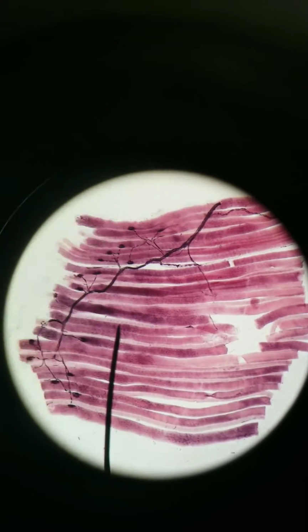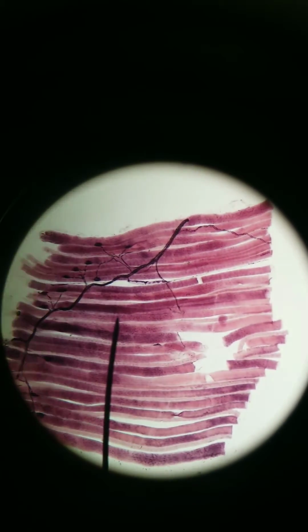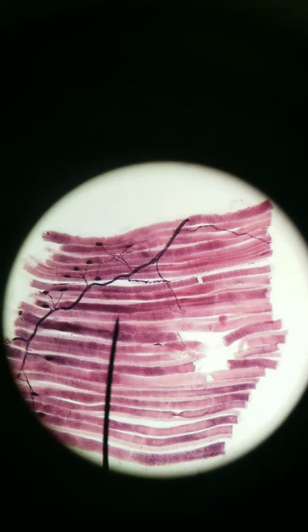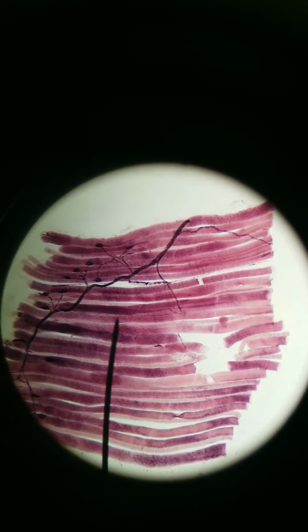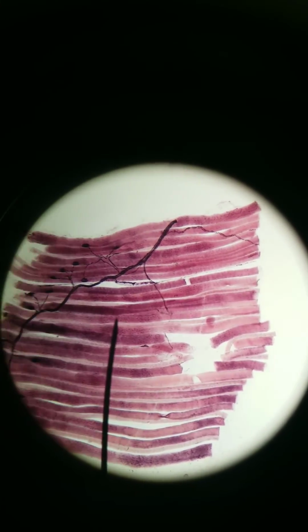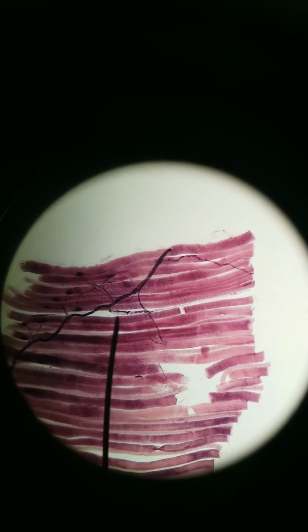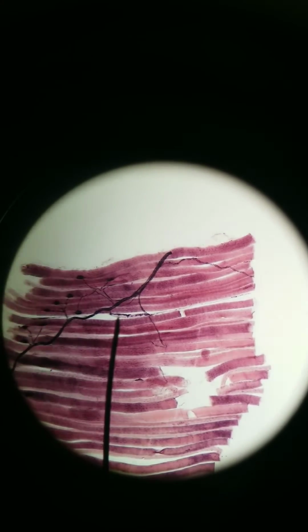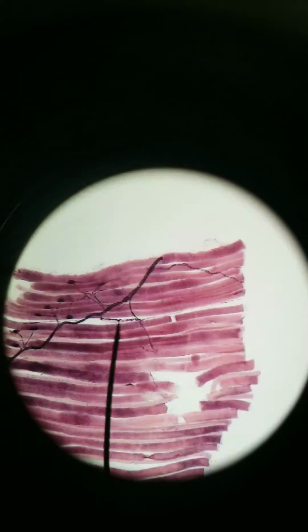But what we can also see in this view is a muscle spindle. Where is it? Most of the things you see, the pink ones that go left and right, are longitudinal cuts of muscle fibers. Another term for these muscle fibers, the ones that do the normal contraction that move our bones around, is extrafusal. These are extrafusal skeletal muscle fibers. But sometimes if you go deeper in, you'll find intrafusal muscle fibers. Where I'm pointing right now is smaller, narrower, and has branches because it has a nervous branch. This is an intrafusal muscle fiber, part of the muscle spindle, going to 400x now.